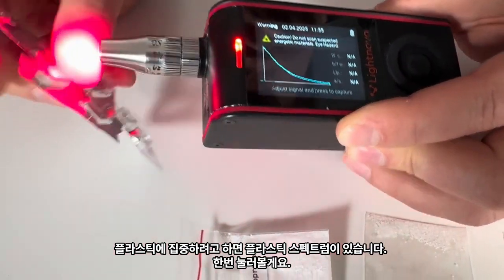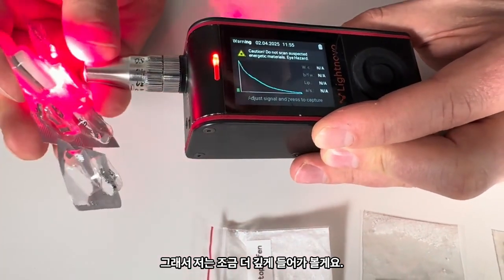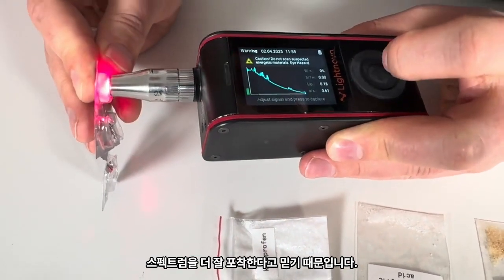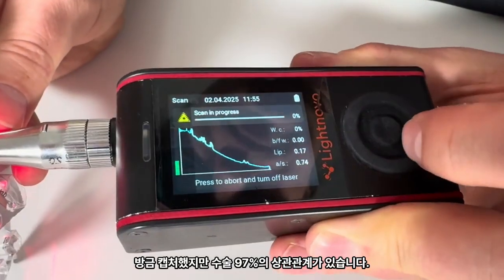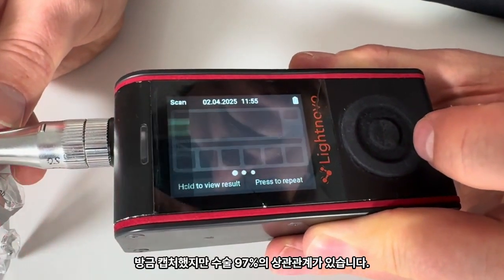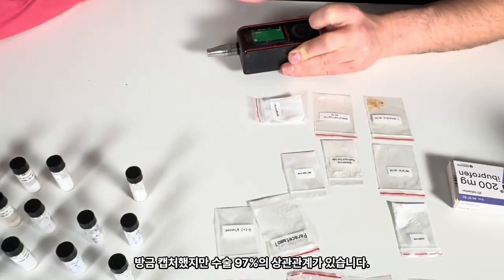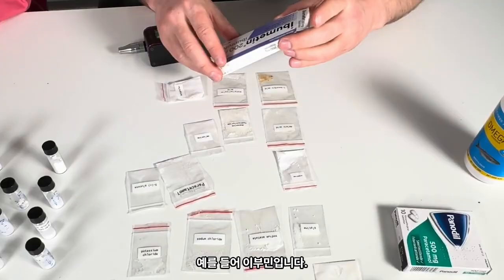Hard to focus. Okay, let's just go directly to the paracetamol. And for that, I would go slightly deeper because I believe that this plastic is, and you see, the spectrum is better. I capture. Press capture. Paracetamol, 97% correlation.